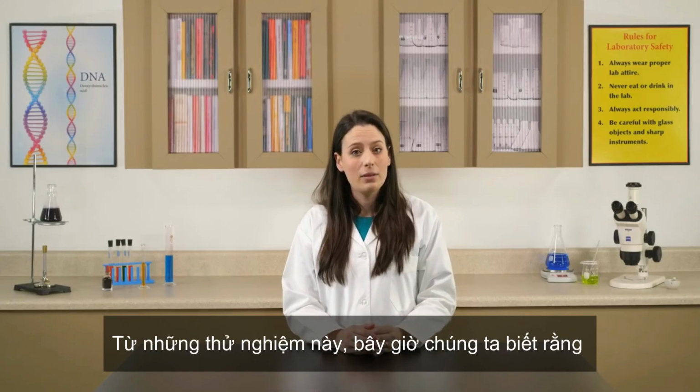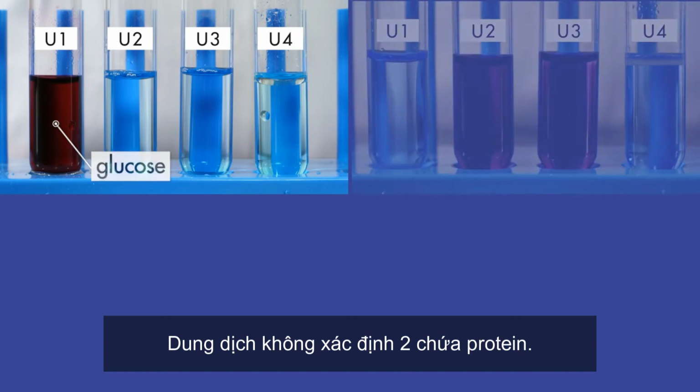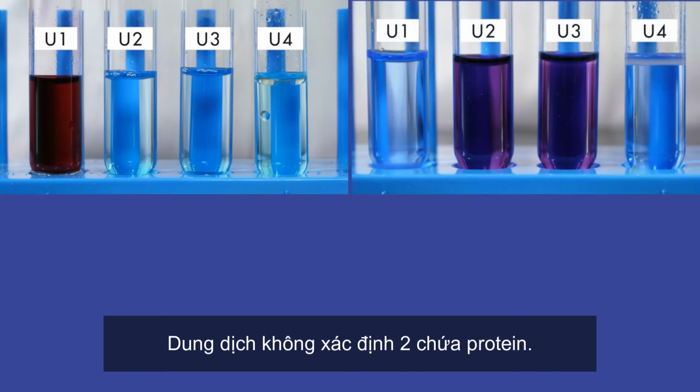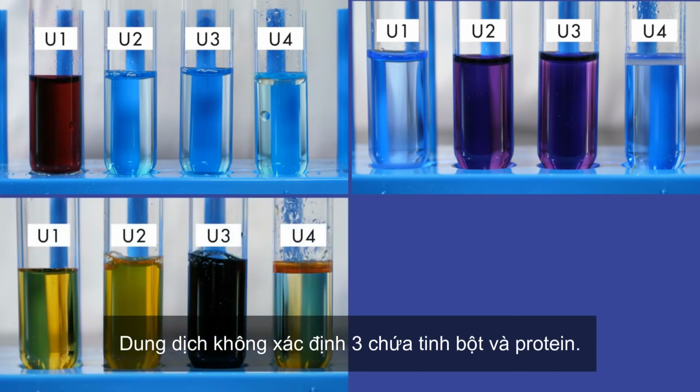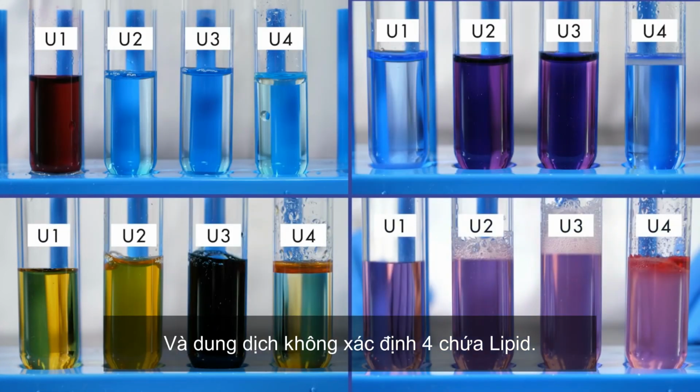From these tests, we now know that unknown solution 1 contains glucose. Unknown solution 2 contains protein. Unknown solution 3 contains starch and protein, and unknown solution 4 contains lipids.